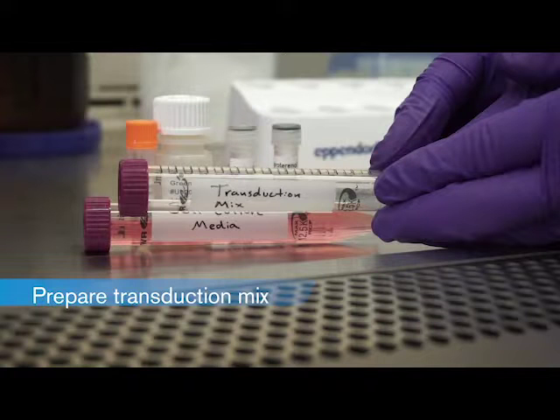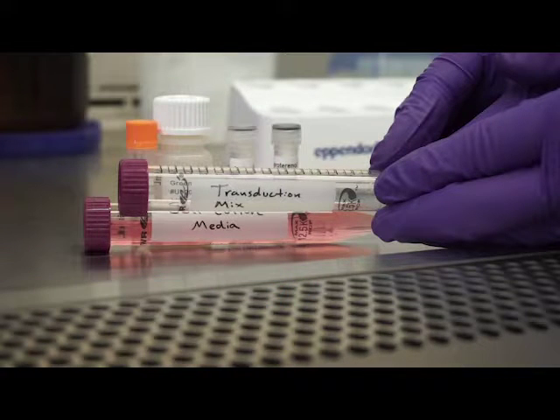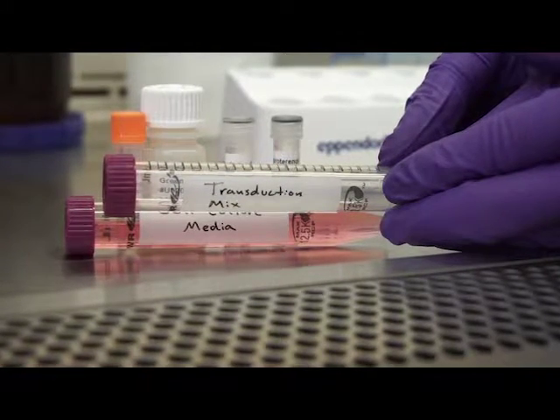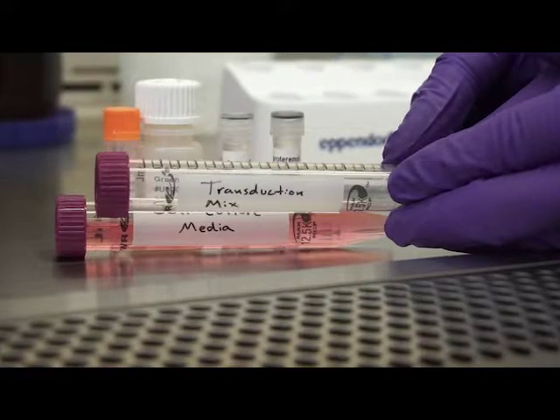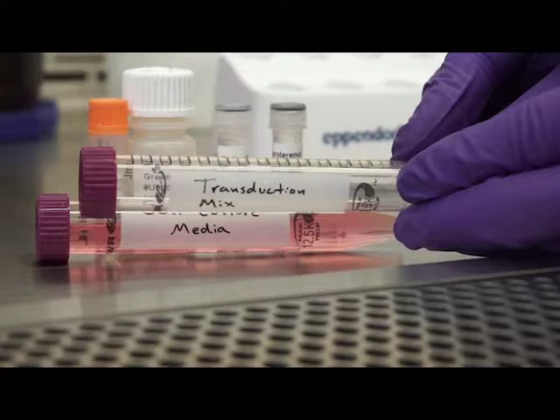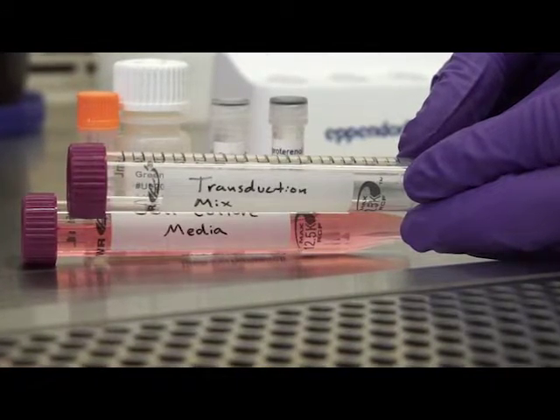Please refer to your detailed protocol to find the recommended volumes of each reagent to be added. Keep in mind, however, that while the volumes recommended in the protocol are a good starting point, you may need to perform a titration of the sensor BACMAM stock to determine the amount that results in optimal assay performance.